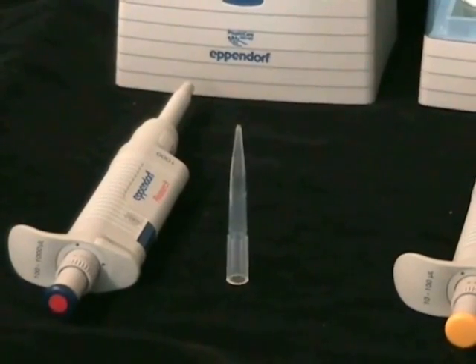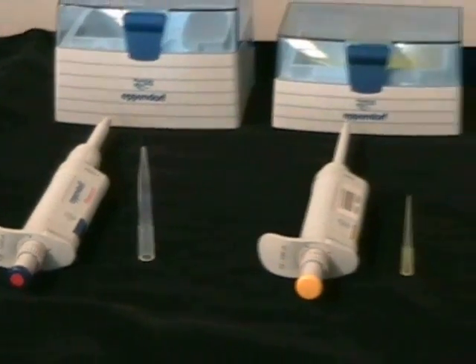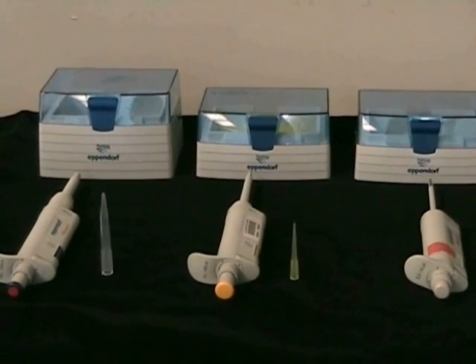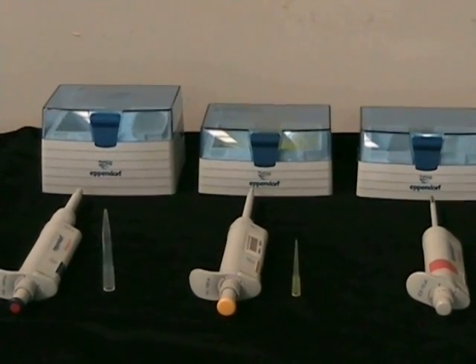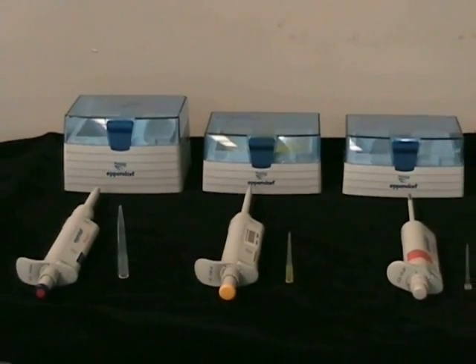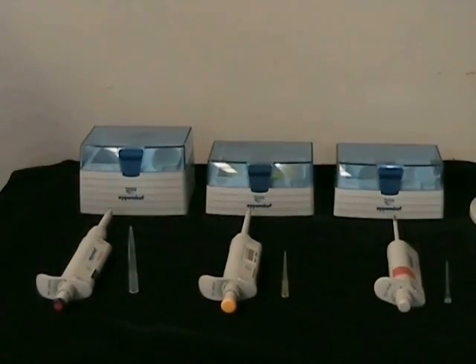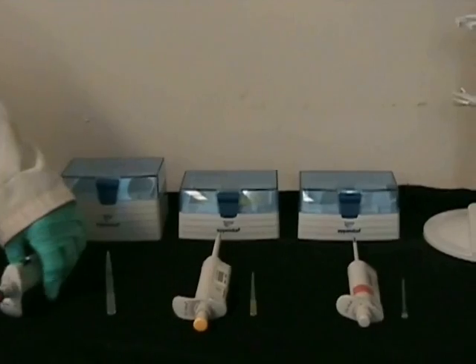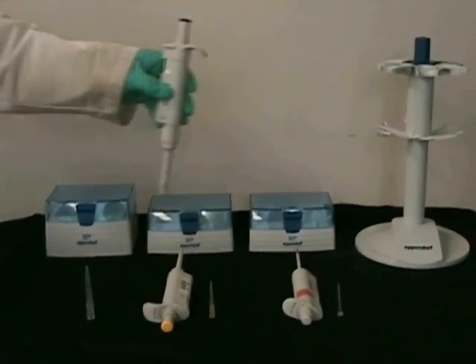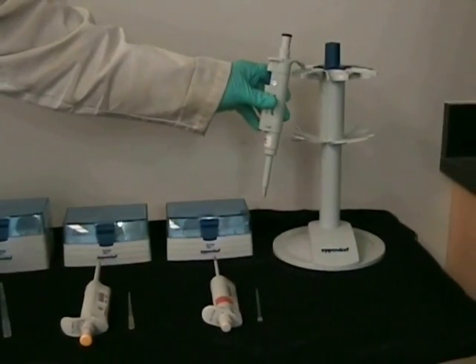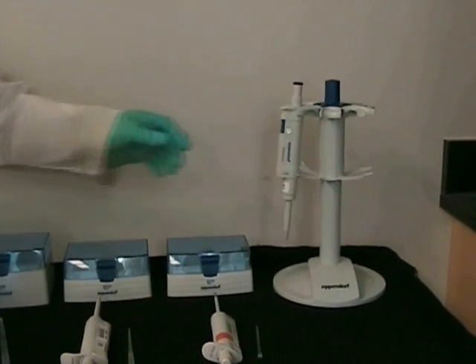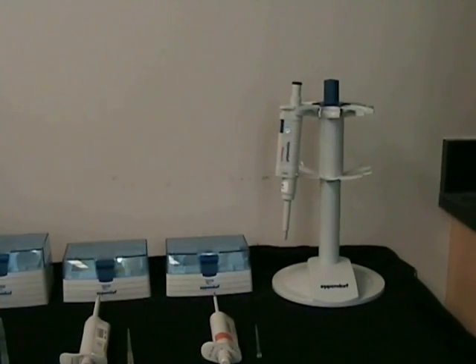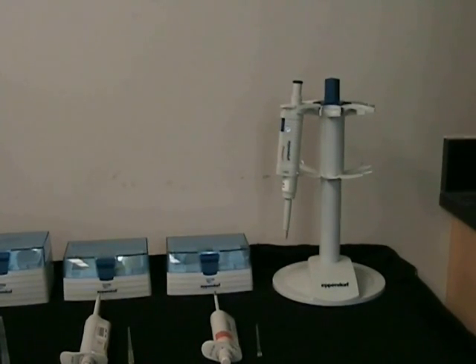Now the display is horizontal, which is very unusual for this kind of pipettes. When you finish your work, it is imperative that you leave it in a vertical fashion. For that we have a holder, so you take your pipette and simply hang it in your holder. This way it will allow any liquid that might have gone into the pipette to drain, minimizing damage to the mechanism.